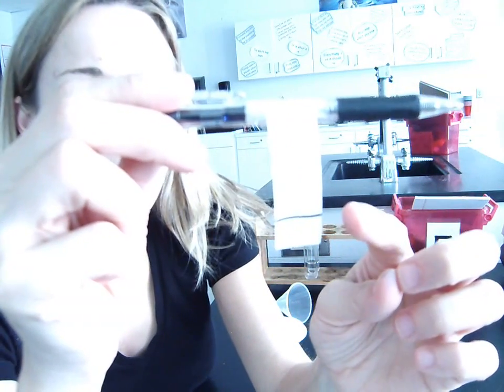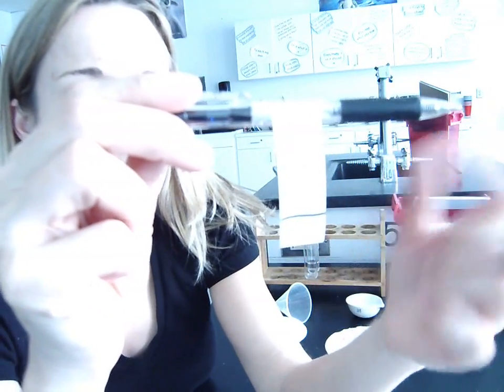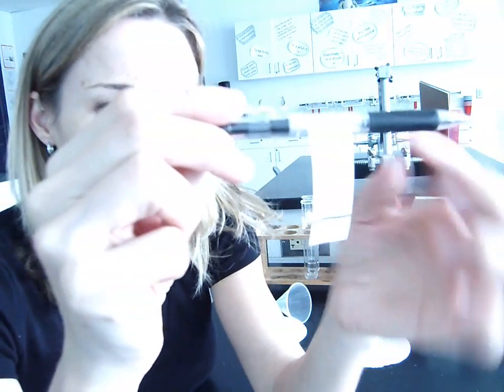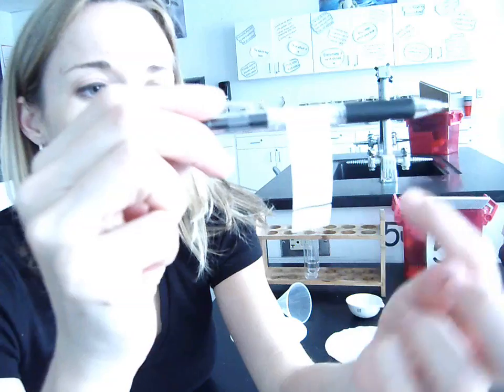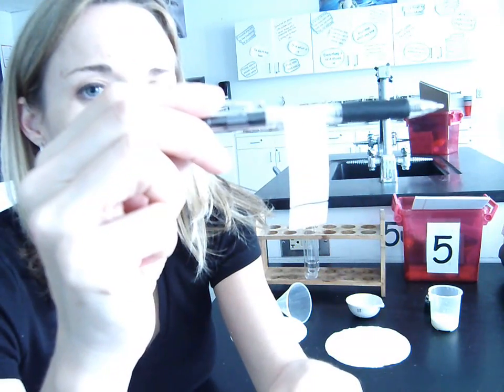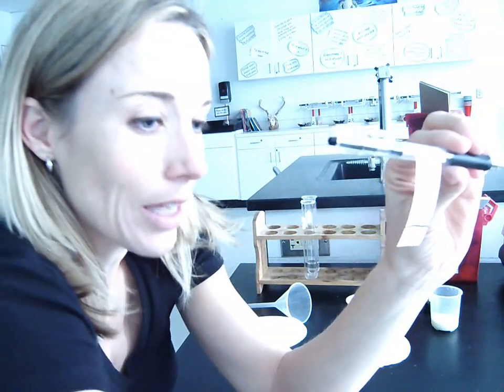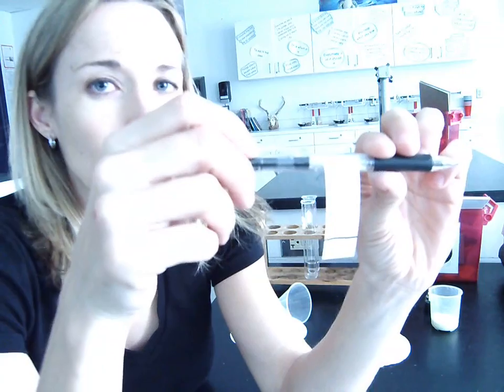And so this method is going to show us that even when we have a very small quantity of a substance available, we still have ways of being able to separate that mixture. So we have to use this special paper called chromatography paper, and we put a line of black ink. The ink has to be water soluble, which means the ink will dissolve in water. If it's permanent ink, it doesn't work.